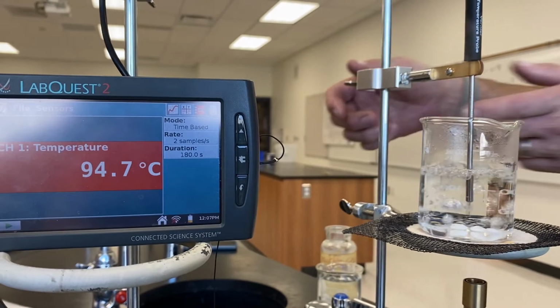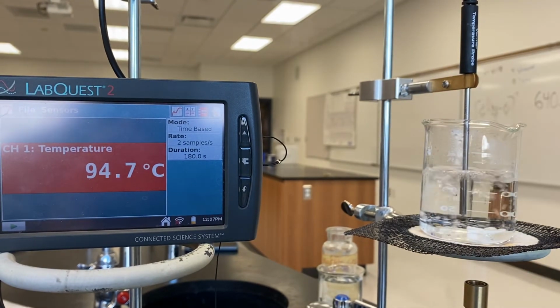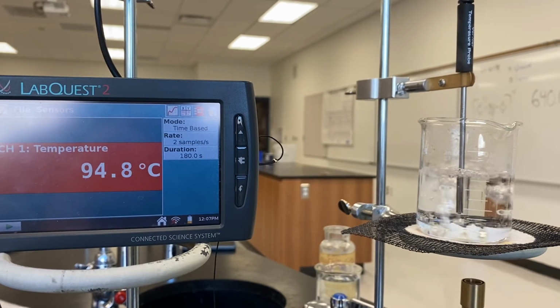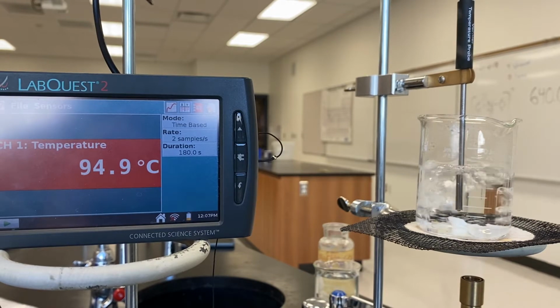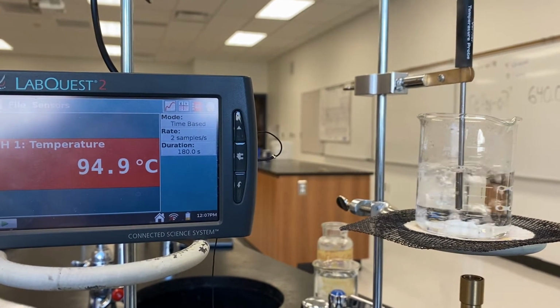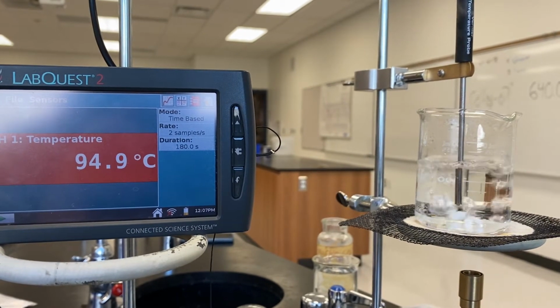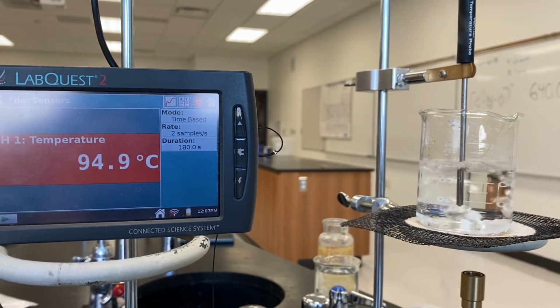Drop this just a little. And we're still at 94.7. Oh, up to 94.9. Shouldn't have said anything. Tight at about 94.9.